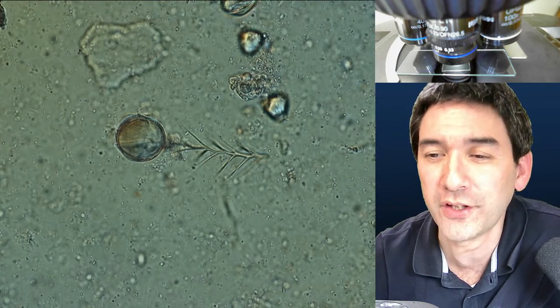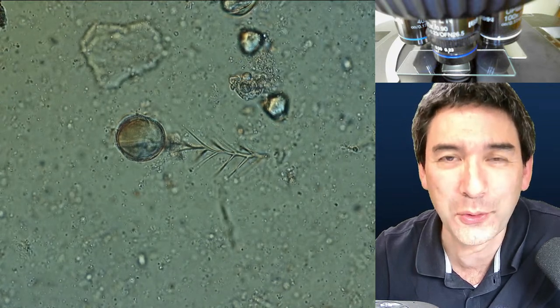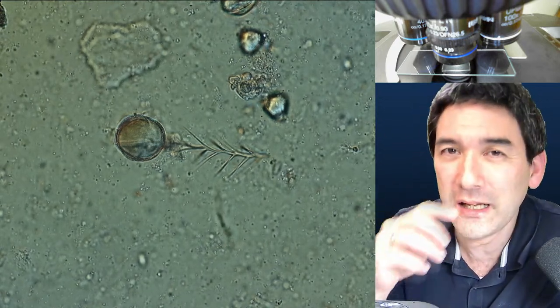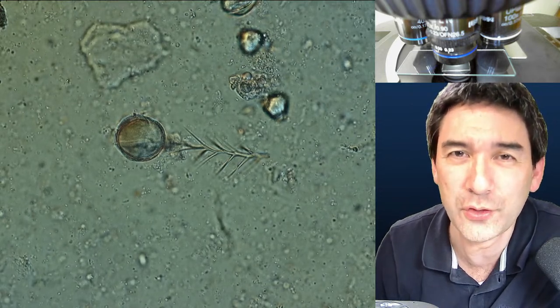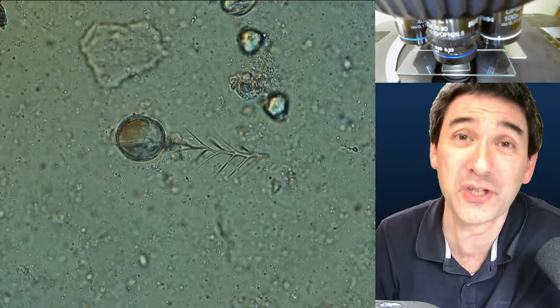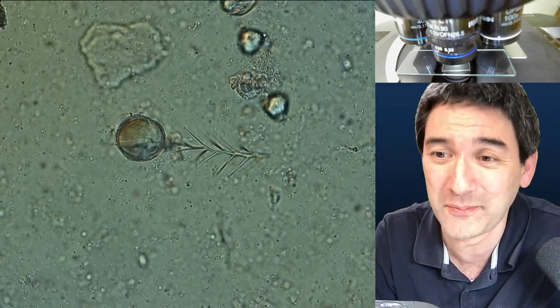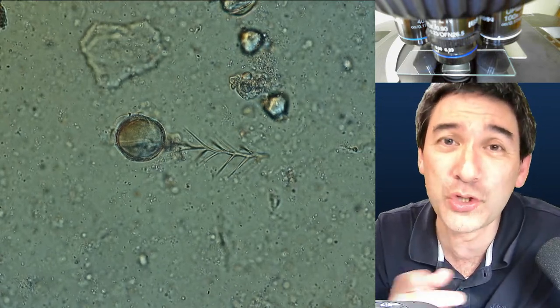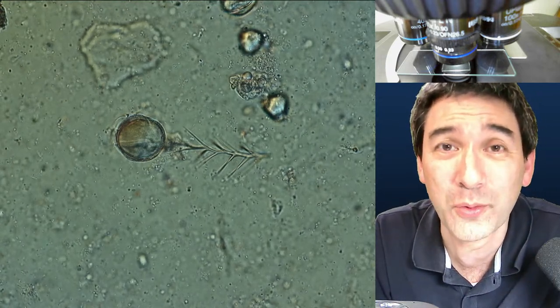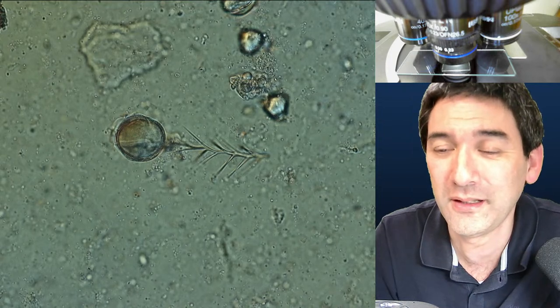Did I ever show a DIY centrifuge on the channel? Yes — a couple of months ago, one of my viewers actually made a centrifuge using an electric drill. Several years ago I also tried to make a centrifuge like that. Somebody once requested a paper centrifuge — this is indeed possible, especially if you want to centrifuge blood, and it gives very high speed rotations. There was also a live stream where people showed some of their DIY centrifuges using a drill and also using a motor.